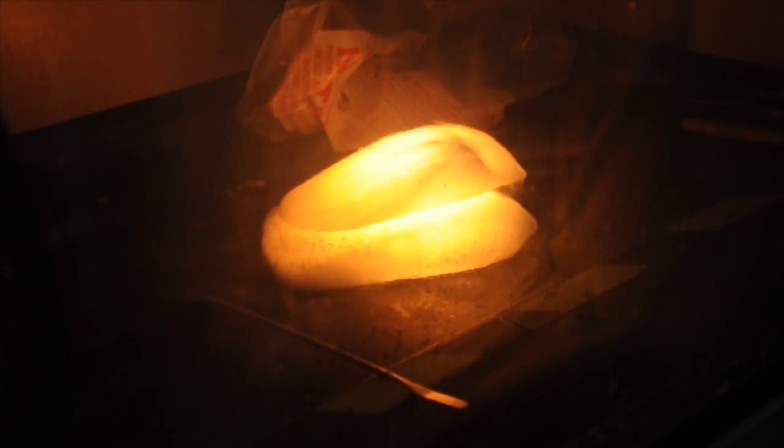The most amazing thing about this is that the fire burning the magnesium is being ignited by the carbon dioxide, which normally puts out fires. So instead of the fire being burned with oxygen, it is being burned with carbon dioxide from the dry ice.